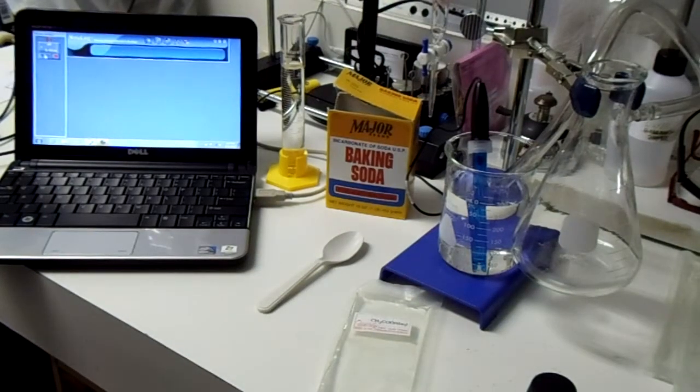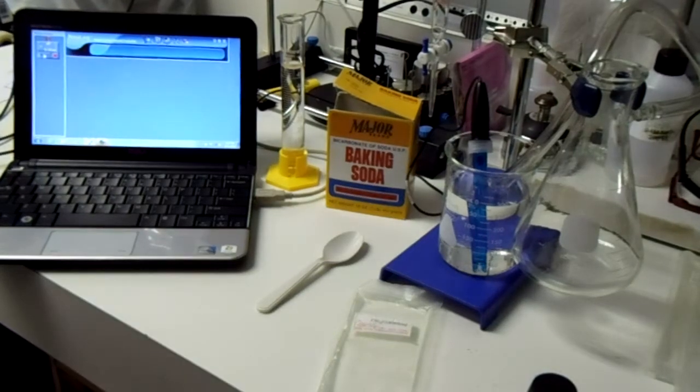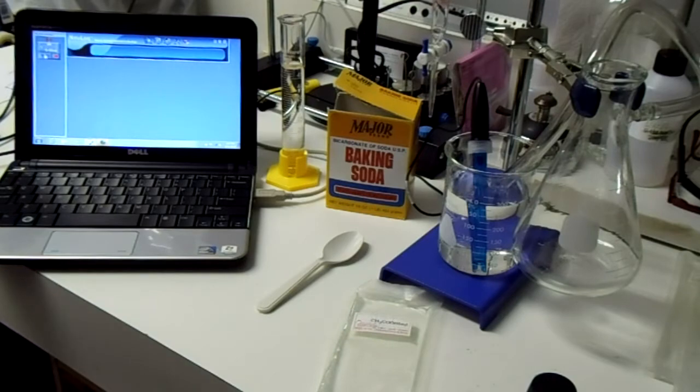Today I'm going to be doing a very simple demonstration of showing you how acid rain forms. Keep in mind, in environmental science we're always concerned about nitrates being released into the air and condensing out into water vapor and falling to earth as rainfall, and of course doing damage to ecosystems. Today we're going to be actually creating a CO2 gas and showing you that same process.